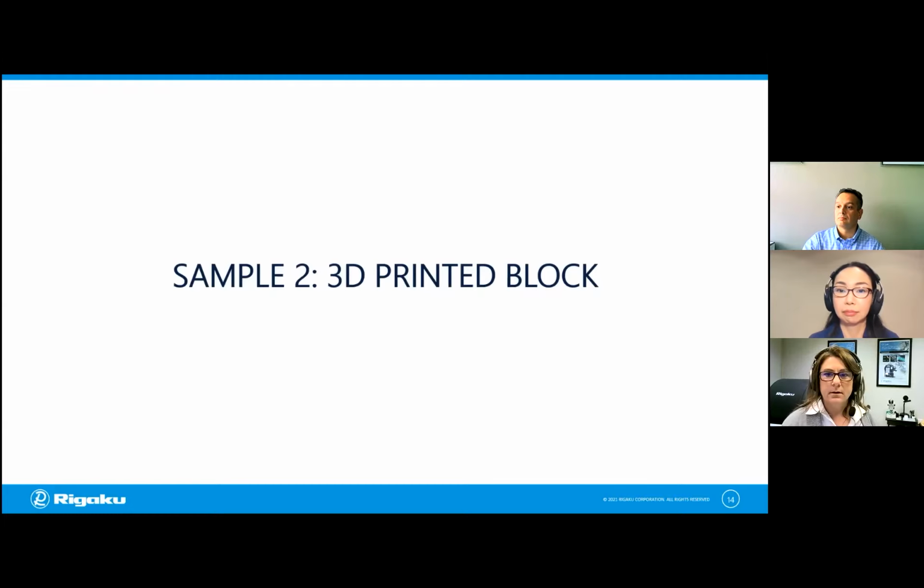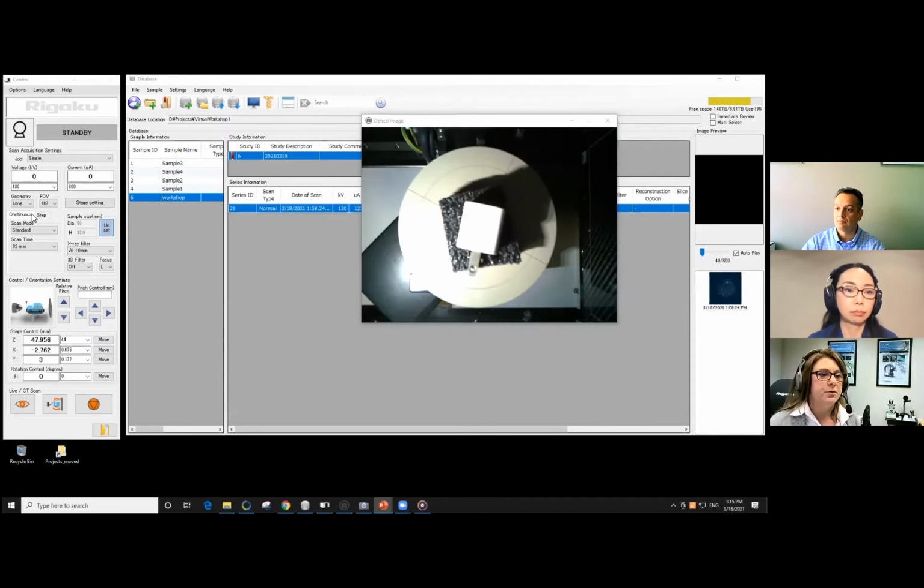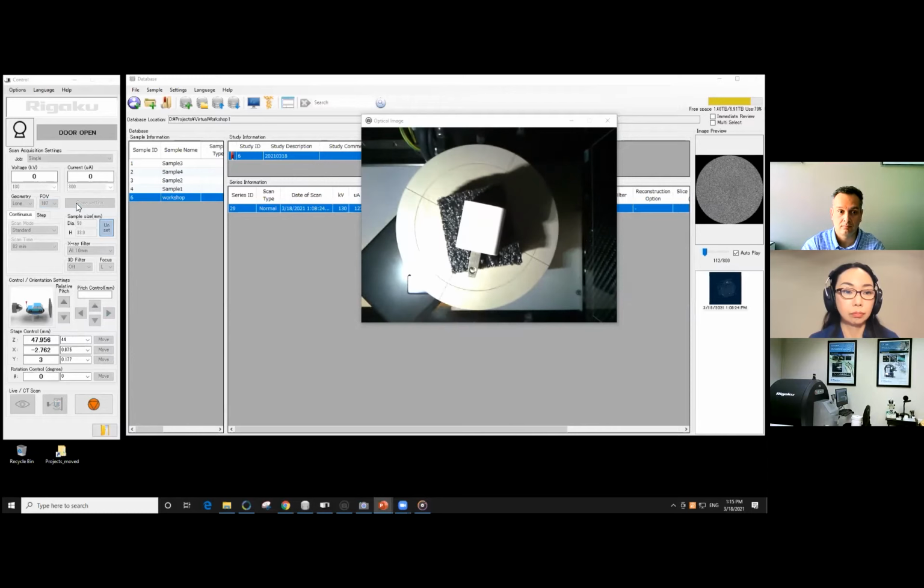All right. So I'm gonna go back to our instrument panel here. I measured the sample. So remember, you need to know the sample size to select the correct field of view. It's pretty big. So I'm going to use about 100 millimeter. I am going to, in fact, change the filter for this particular sample. It doesn't contain metals or anything, and I'm going to change it to aluminum, which is a good one for this. I'm just removing the copper. I don't have to change the drop down, right? Because I've got it already. You already have aluminum, yeah.